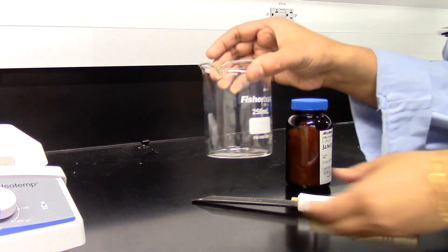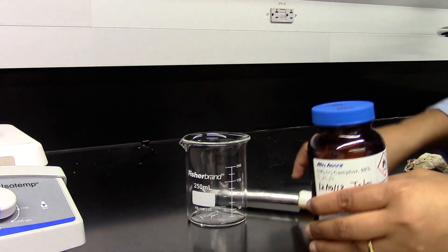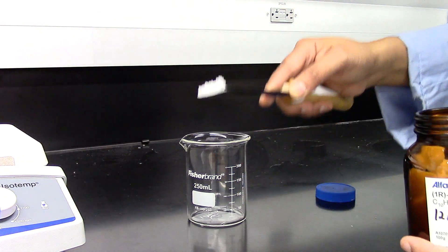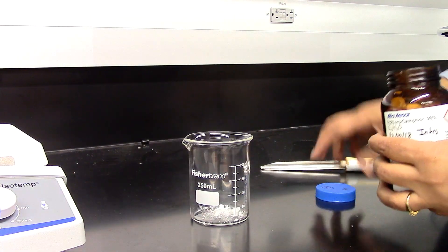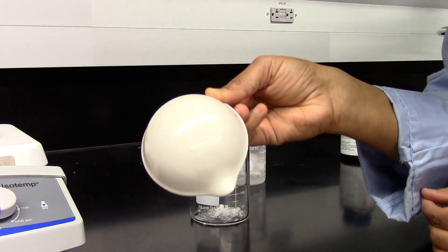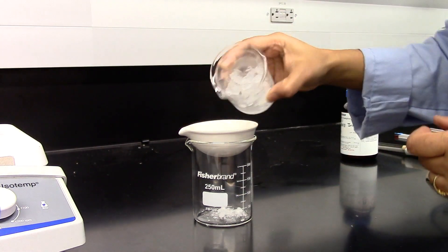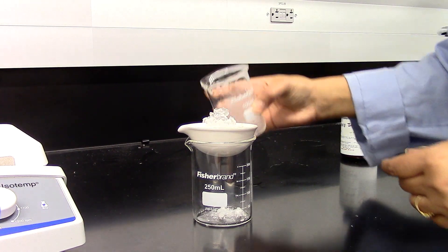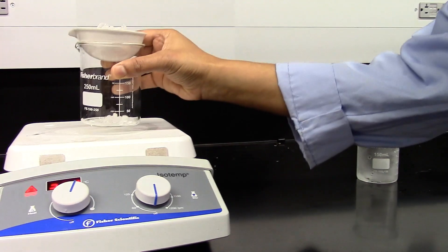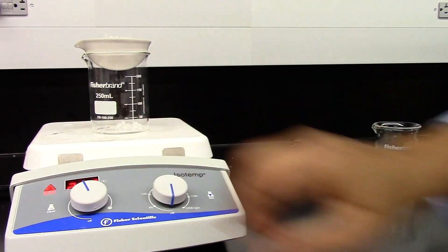For part A demo, we are going to take a clean beaker and add some camphor. Camphor is a white solid. We are going to take a clean evaporating dish, place it on the beaker, and place some ice on top of the evaporating dish. This is going to go on top of the hot plate, and we will gently heat it and see what happens.